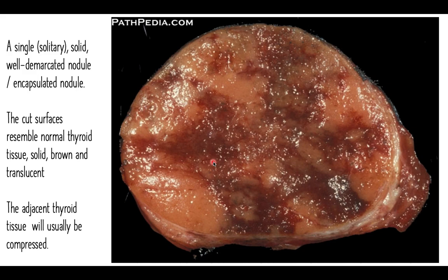the cut section of the thyroid gland shows a single solitary well-demarcated or well-encapsulated nodule. Okay, the cut surface resembles normal thyroid tissue, solid, brownish and translucent, and the adjacent thyroid tissue is being compressed. So this is the typical gross finding for the follicular adenoma.